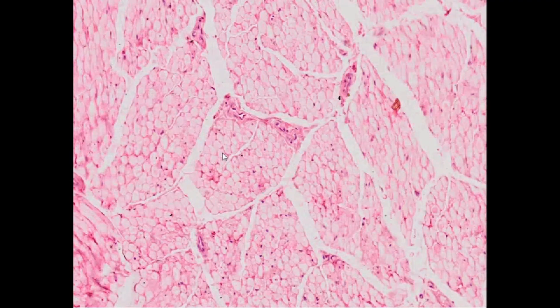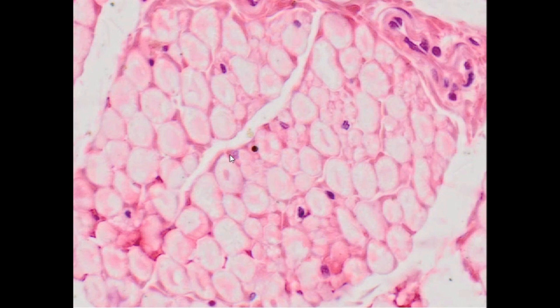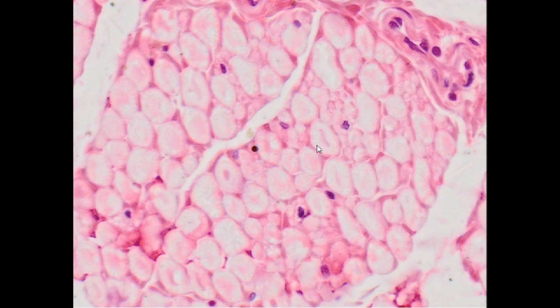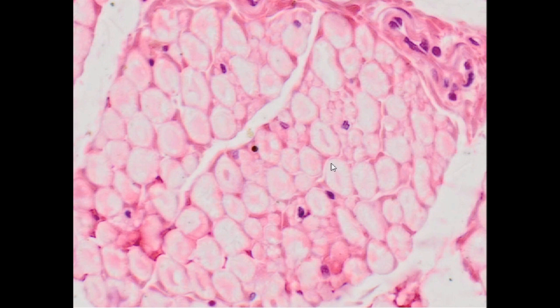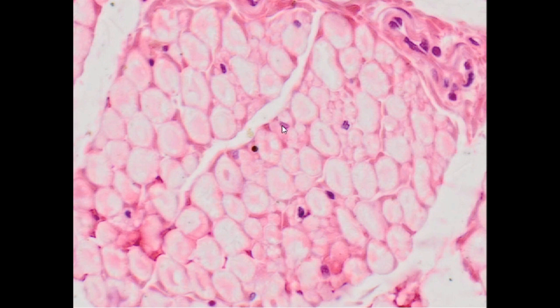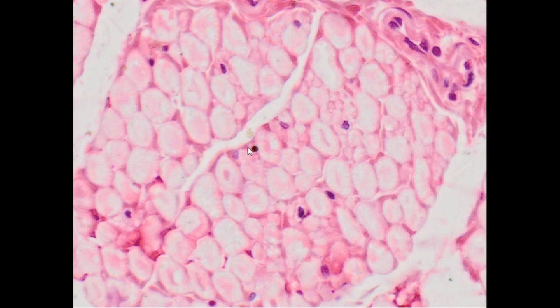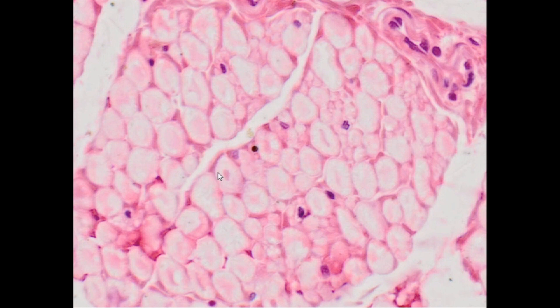Single myelinated axons can be seen in cross-section at high magnifications. Axons are stained light pink, while the myelin sheath remains unstained, as it is made of lipids. Sections through Schwann cell nuclei can be seen in some nerve fibers. Each nerve fiber, along with its myelin and Schwann cell, is surrounded by delicate connective tissue called the endoneurium.